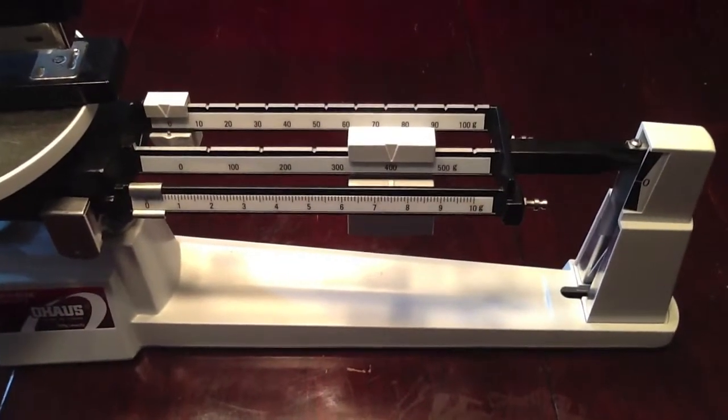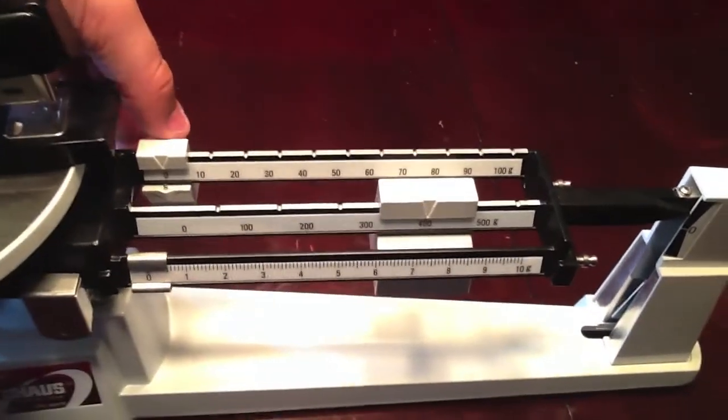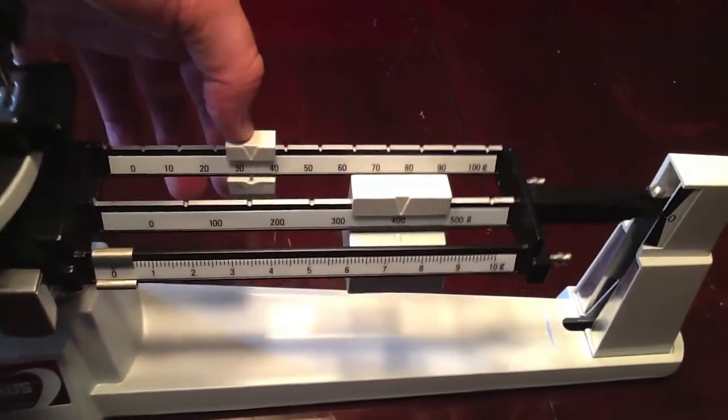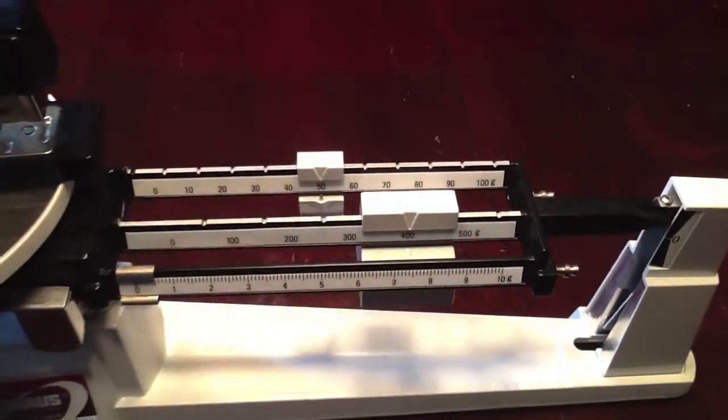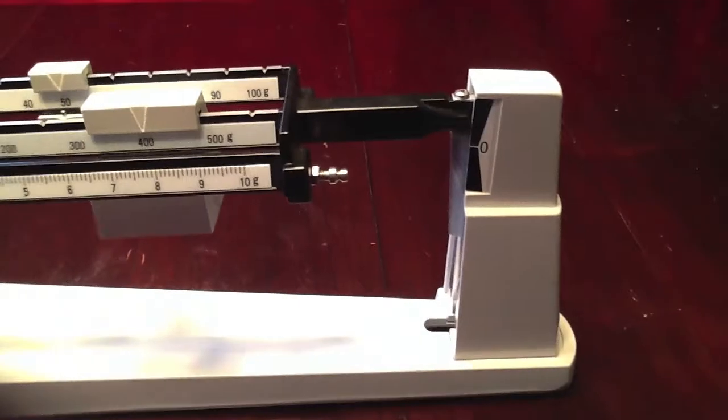Now that we've moved the 100 gram rider, we need to move the 10 gram rider. We're at 450 grams and it's still above the zero, so let's continue to move the 10 gram rider.